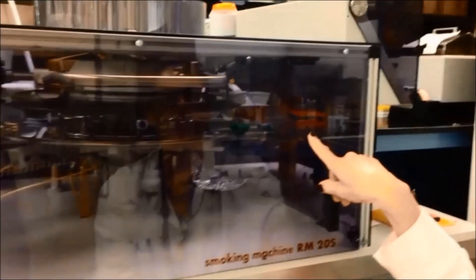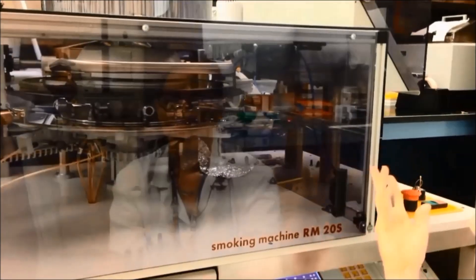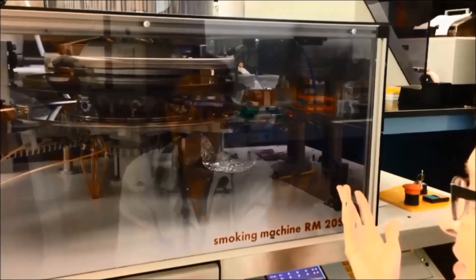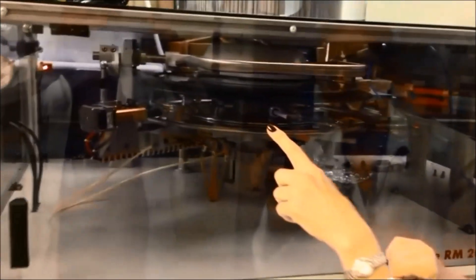There's the cigarette going in. It's now in place, it's moving around and the lighter is starting to come out. The lighter will light the end of the cigarette.